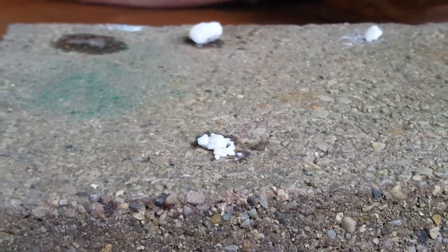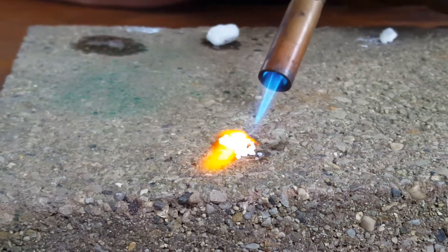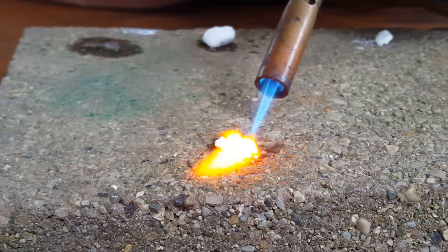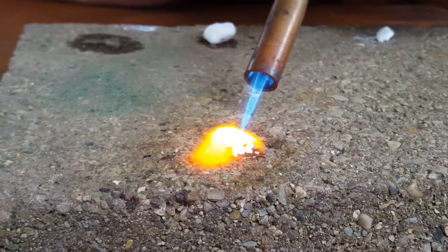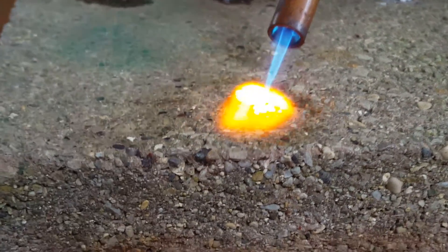And this salt is calcium chloride. It burns with a darker orange flame than sodium.